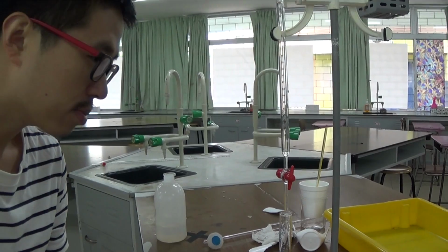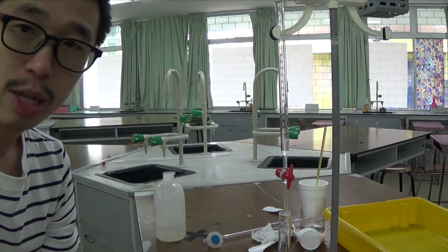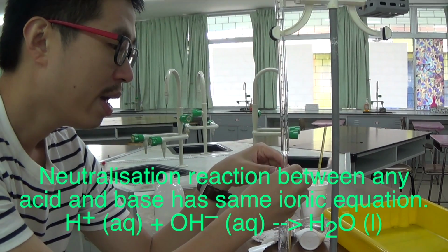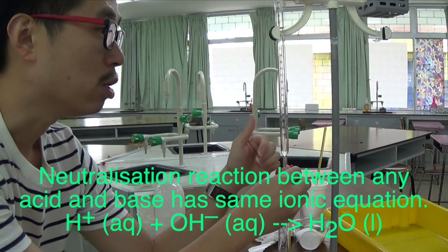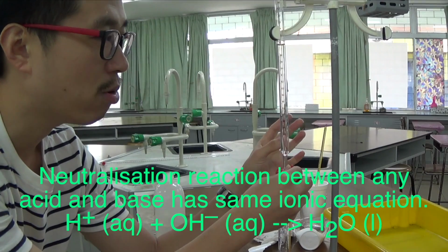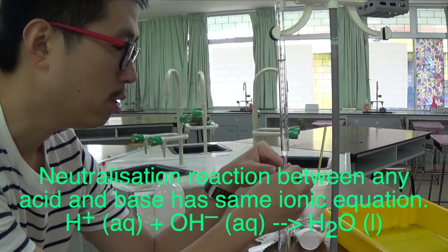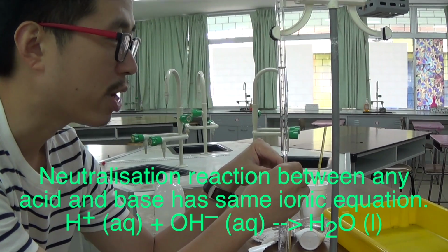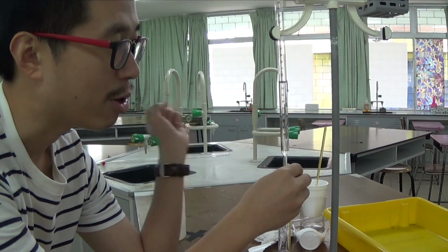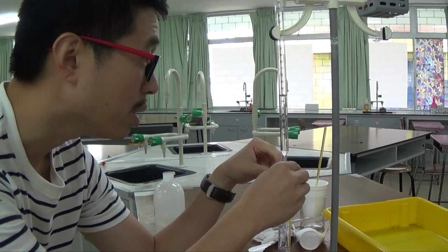Oops, sorry. So this is the very last thing. We're just getting ready for the very last experiment that we're going to do to monitor this temperature change when this acid reacts with this base. Any acid reacts with any base in a neutralization reaction. Every single neutralization reaction has H plus aqueous combining with OH minus aqueous. It's going to be exothermic. Neutralization is an exothermic reaction. The temperature of the solution, which is the surrounding, will go up because the system releases energy to the surrounding. The surrounding gets hotter. You see an increase in temperature.